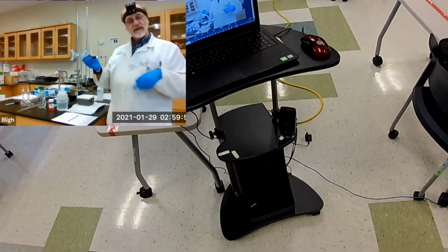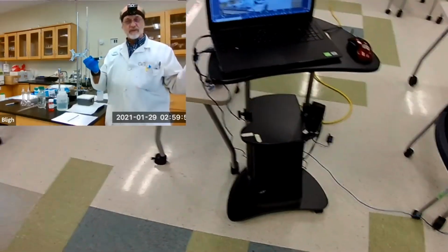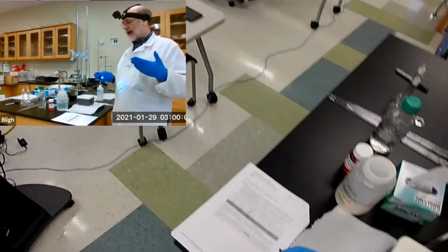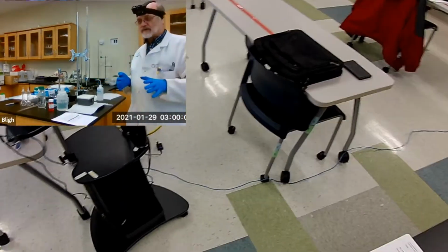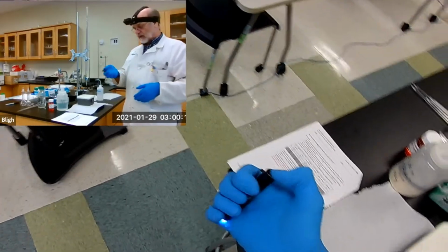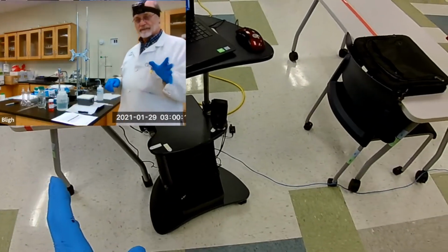If it's a solution, then the light will go through the solution, out the other side, and you can catch the beam on the other side, but you won't see it in the solution. So in order to do that and accurately detect it, I have to dim the lights. So that's another problem. The video may not pick up all of the things, so I'll continue to narrate as we go. All right, so there's my light, and we need to make the solution, okay?